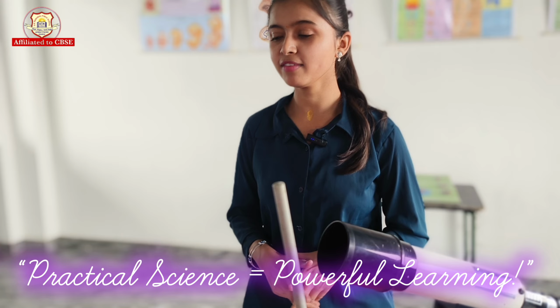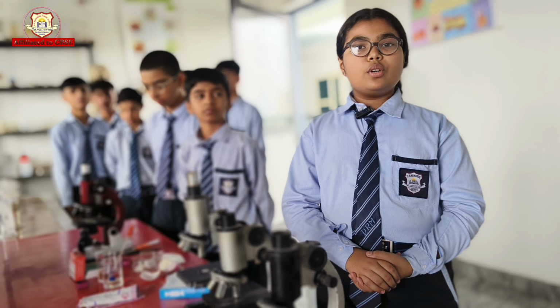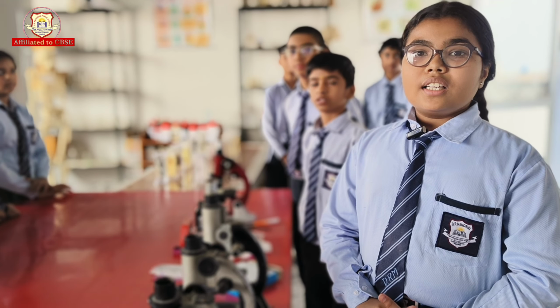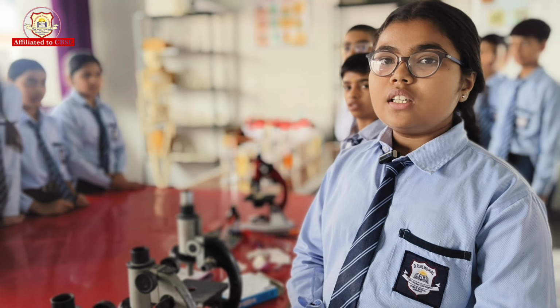Good morning, students. I know that you all have seen and eaten onion, but today I will show you the cells of onion peel. Good morning everyone. Today my friend and I prepare the slide of onion peel and observe it under the compound microscope. Through this experiment, we can understand the structure of the plant cell.